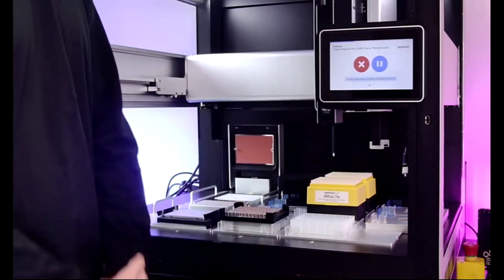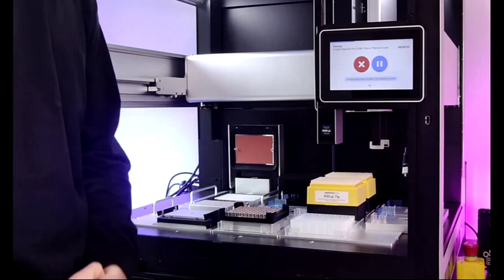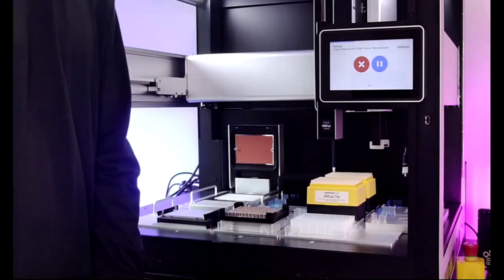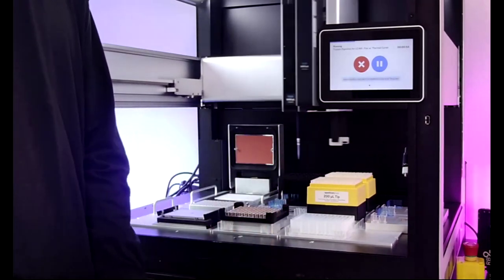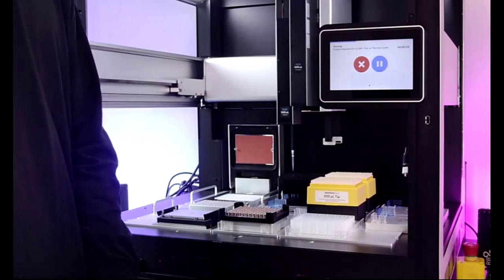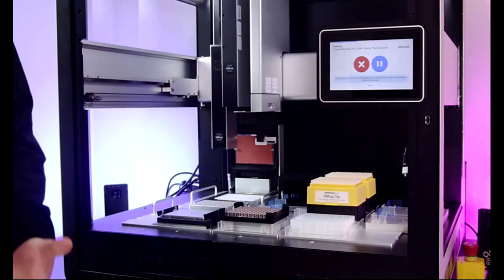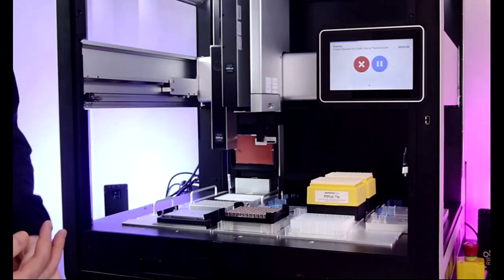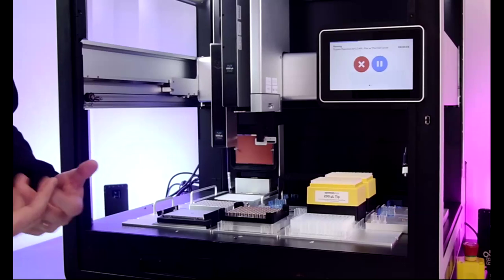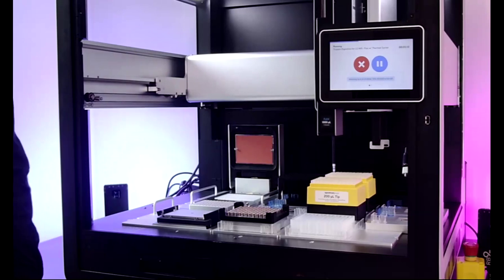As you can also maybe tell, there are short descriptions of each step that are going to populate in. This is another really helpful feature of protocols that have been downloaded from the protocol library, is that these are written out in the Python script as commented out lines. And so it's really very nice to see what these relevant steps look like in a robustly designed protocol.